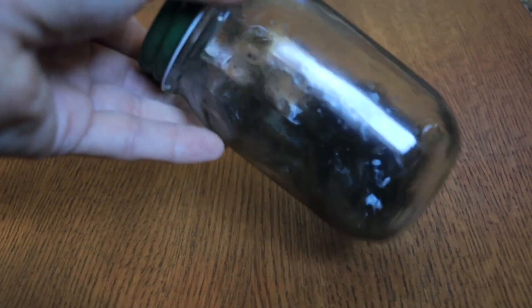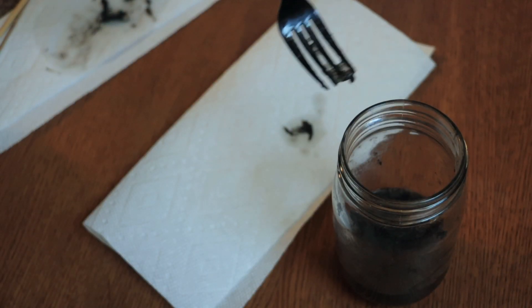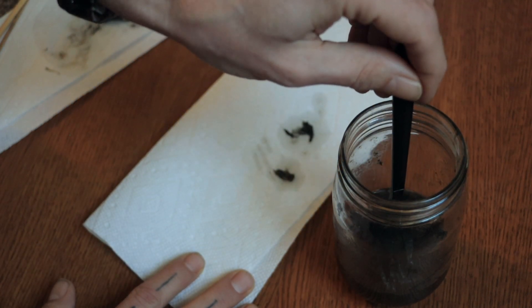They're not as brittle. They don't snap as easily as they did in previous experiments I've run — that's a really nice bonus. I just kept shaking the jar and agitating it every couple of days until finally everything was good and saturated. Then I took some toothpicks and started removing all the fur I could, skimming off any excess fur that floated to the top, until I had nothing left but bones.